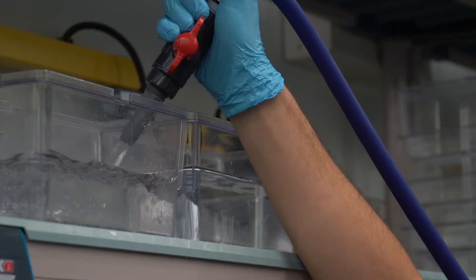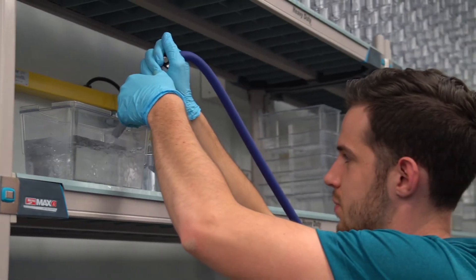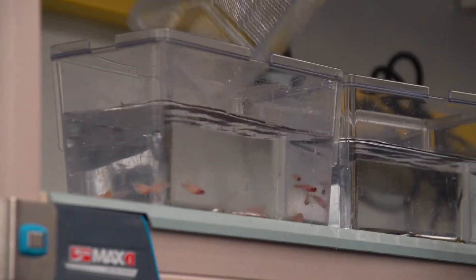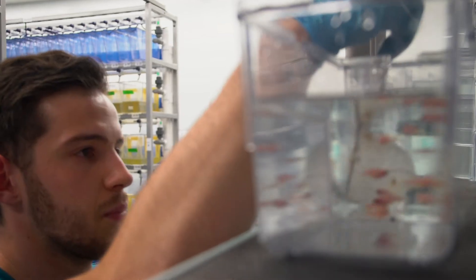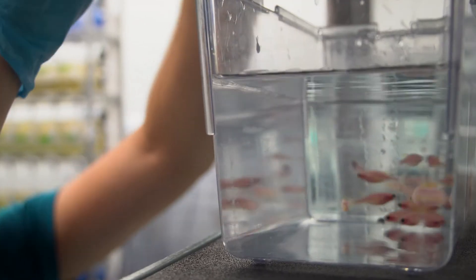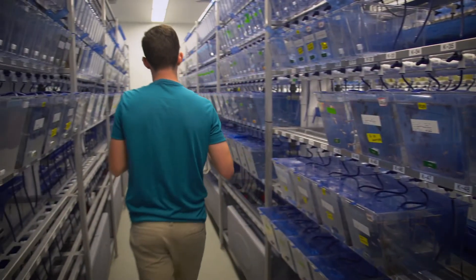In all of those cases, we can take those fish and expose them to drugs by adding drugs actually just to the water where these little baby zebrafish, where these larvae are, and then we can look at drug responses.